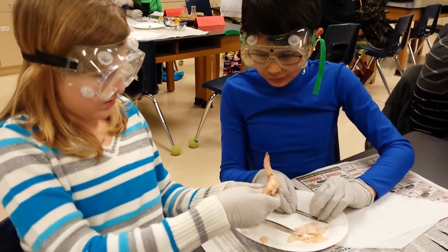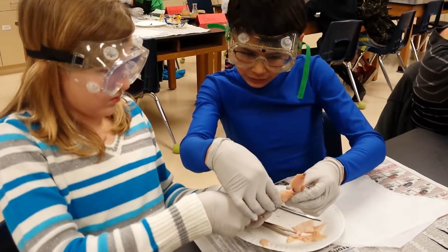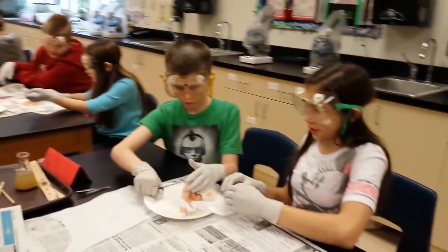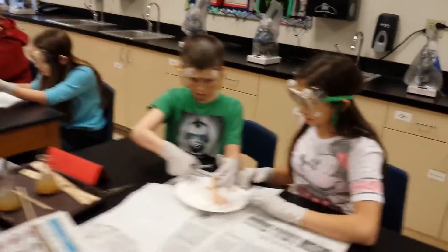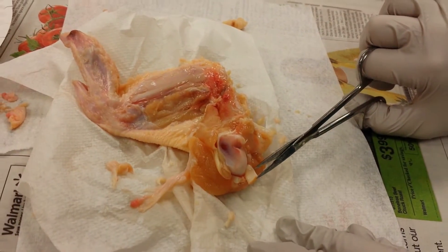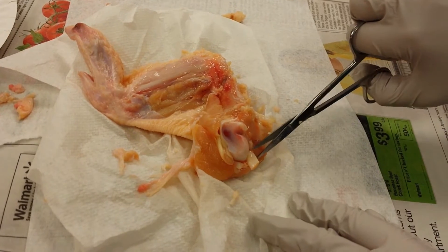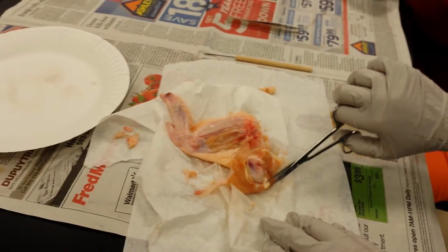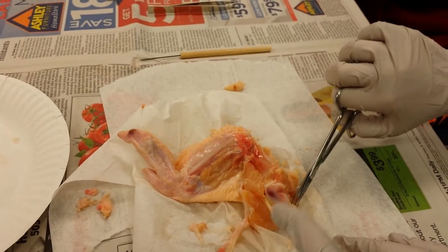Like pinching it. This one — or it can be in. This moves this. We go in to the side. Oh yeah, what's that? It's right on the end of the bone, and it was cut off. Probably the ligament, because it's probably connected to the other bone that was right here.